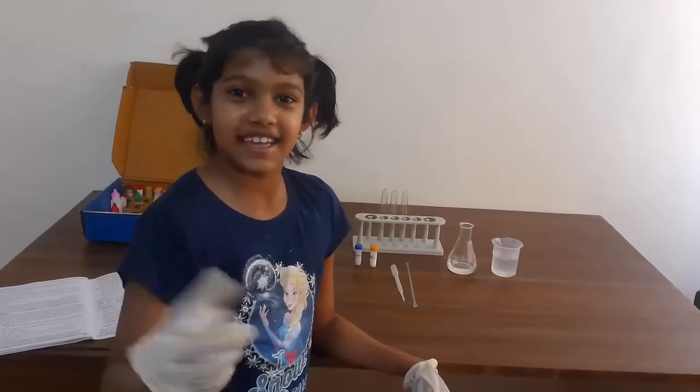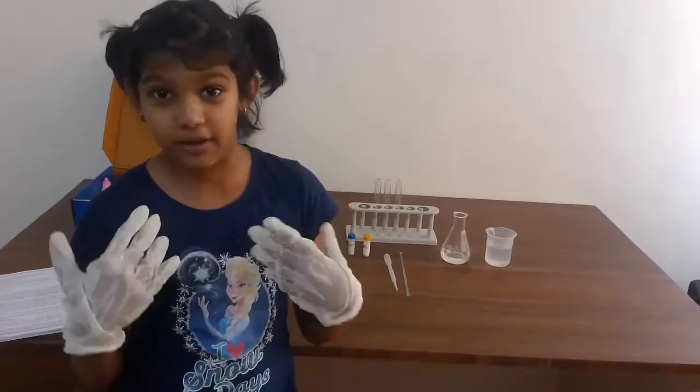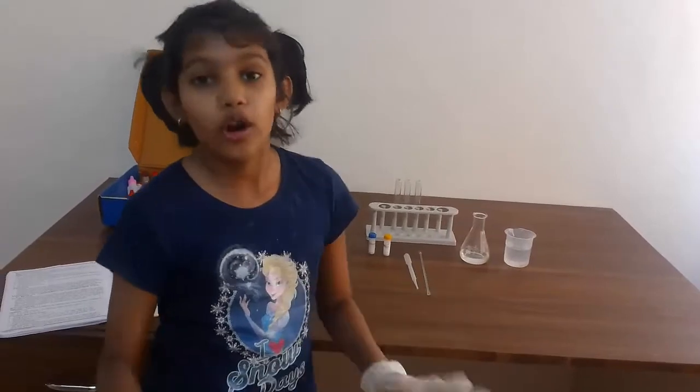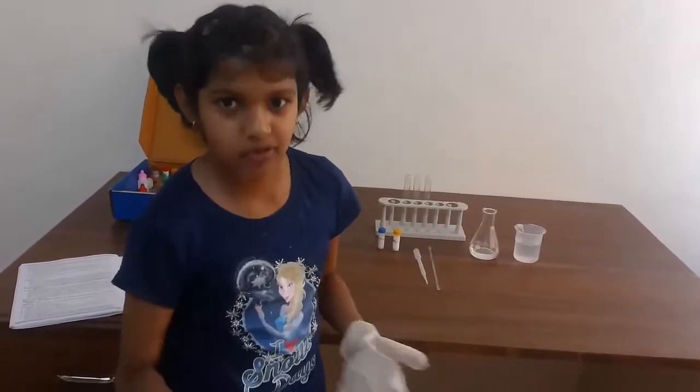Hi guys, today we're going to be doing a little bit of chemistry. Today we're going to be doing a double displacement reaction, or you could say a double replacement reaction.